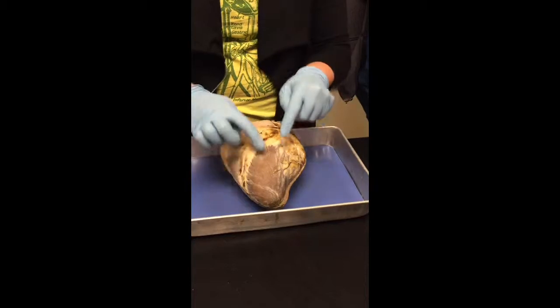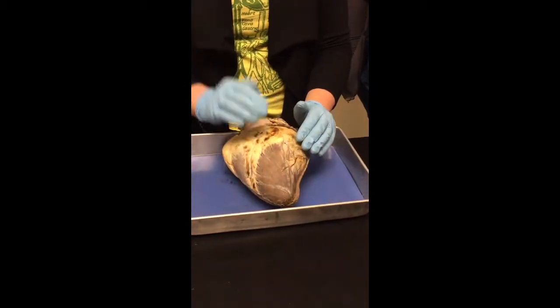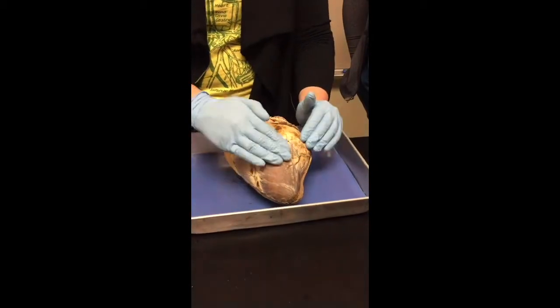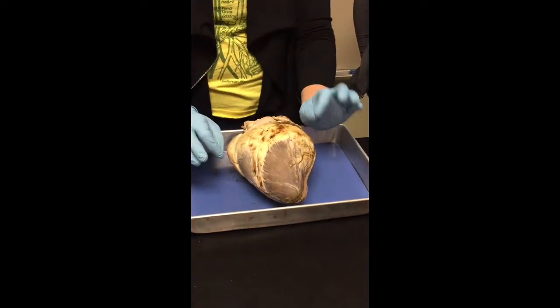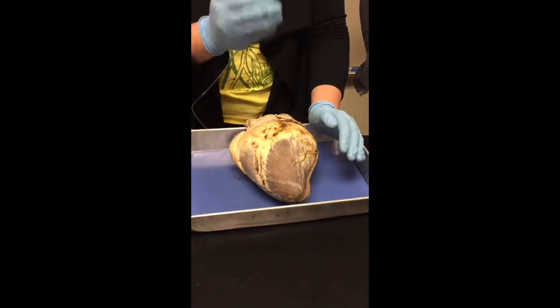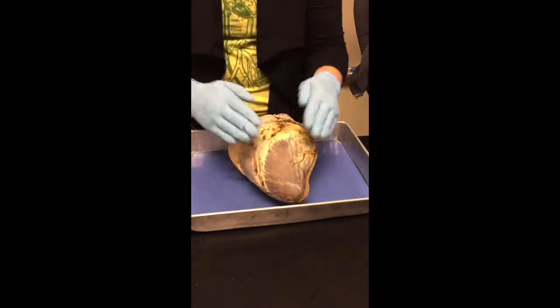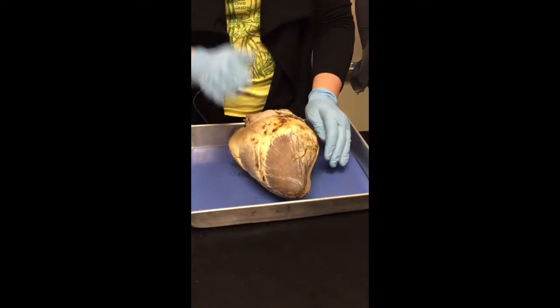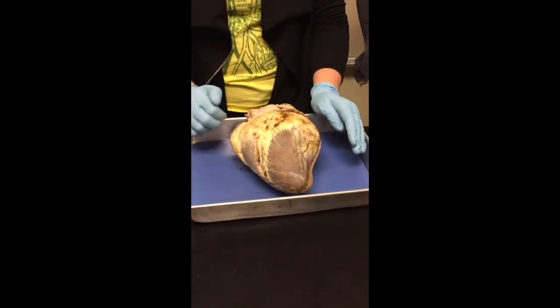When you're touching the heart, just touching the outside of the heart, anywhere, what you're touching is the tissue called epicardium. Epicardium because epi means above, okay? So it's what's directly attached to the outside of the heart. It's also called the visceral pericardium. If you remember learning the serous membranes, the visceral is actually attached to the organ, whereas the parietal lines the cavity. Does anyone remember that? So epicardium and visceral pericardium mean the same thing, okay?